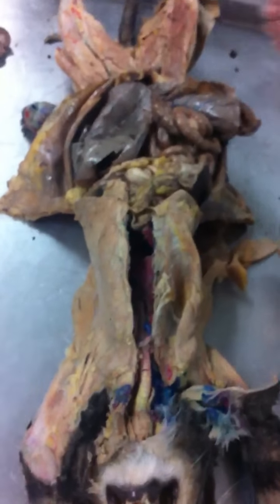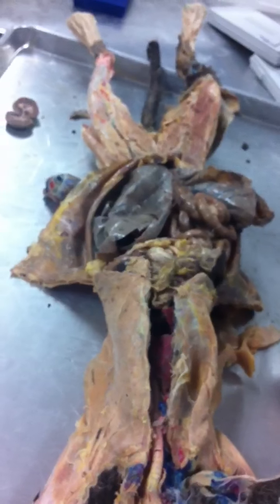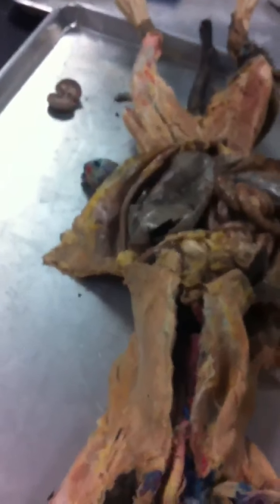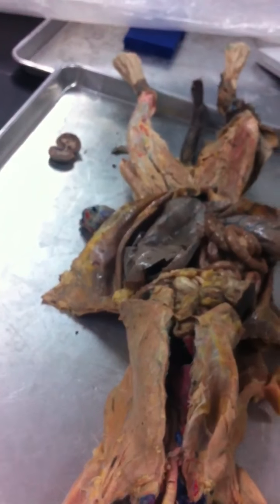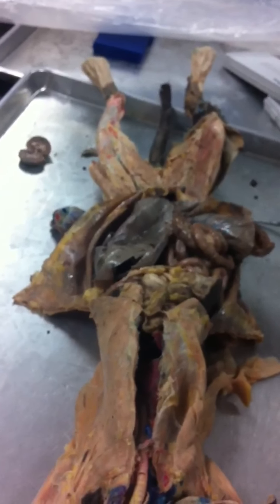All right, now for the male kitty cat. There are four parts you need to know for the male: testes, spermatic cord, penis, and glands. Can you identify a testes if there's one pin? It's a big tan ball. Coming out of that, there's a little tubule called the spermatic cord. What goes through it? Sperm. So testes make the sperm, and sperm travels through the spermatic cord. In humans, you have the vas deferens, same function. All those tubules there.